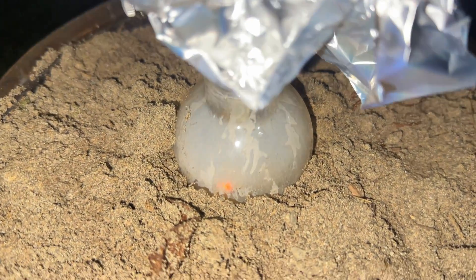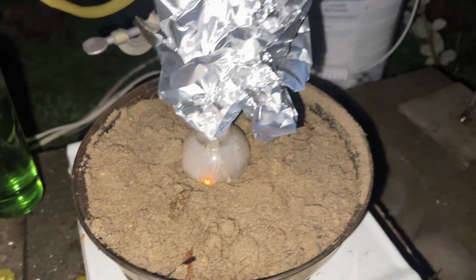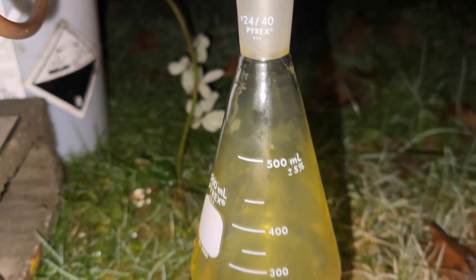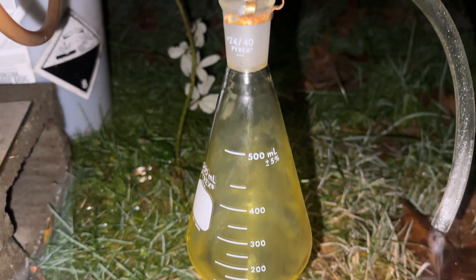As the reaction proceeded, it was going rather slow, so I cranked the hot plate to distill over all the tin-4 chloride and melt the remaining tin. The chlorine production rate was also slightly increased, which resulted in a somewhat steady tin-chlorine fire in the flask. I found the reaction proceeds best with molten tin and a steady flow of chlorine to sustain the fire. This produced tin-4 chloride at an appreciable rate, which distilled and collected in the flask.